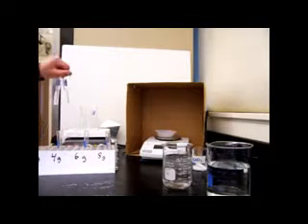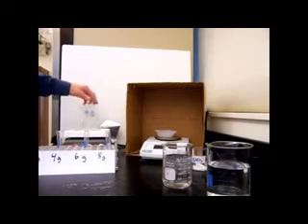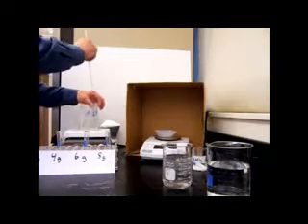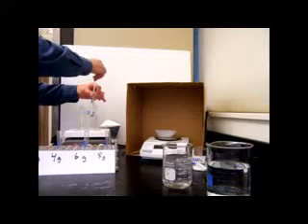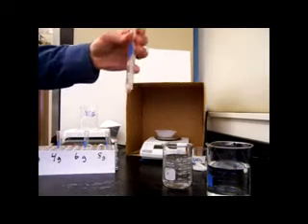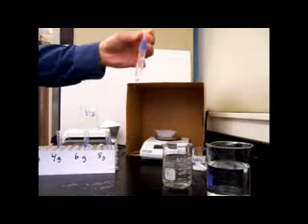So we're going to take the test tubes, I already have some set up from earlier, and put them into a hot water bath. And in the hot water bath, we're going to stir these solutions until the salts have completely dissolved. So this is what the salt crystals look like before they've been dissolved. You can see the little particles still in the solution.